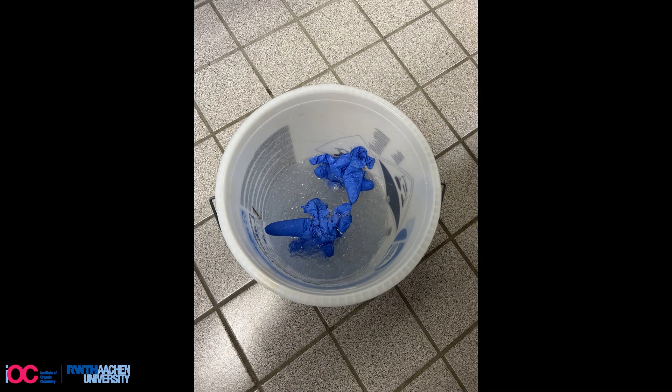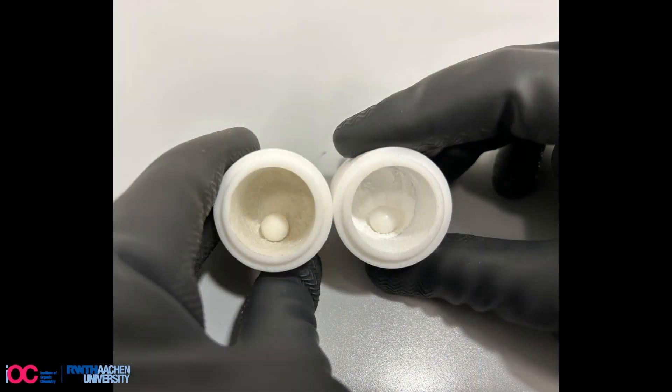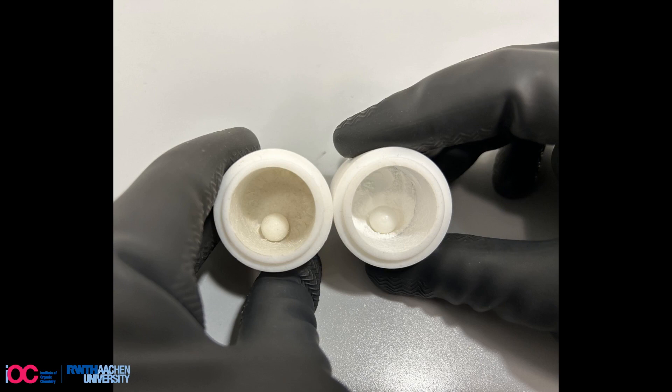Once again, the milling jar is cooled in an ice bath prior to opening. While I am now collecting the powdery crude product, let me briefly comment on the modified reaction conditions.